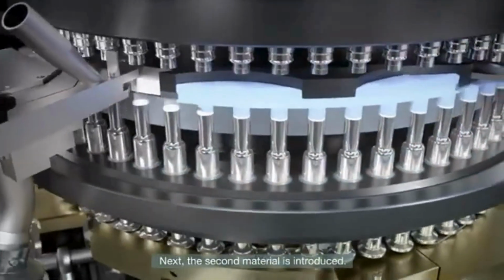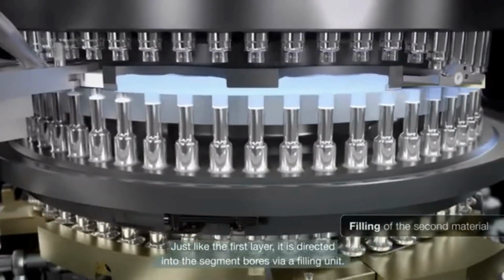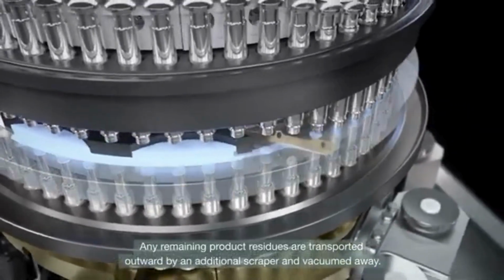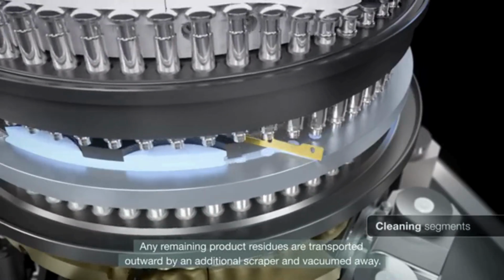Next, the second material is introduced. Just like the first layer, it is directed into the segment bores via a filling unit. Any remaining product residues are transported outward by an additional scraper and vacuumed away.